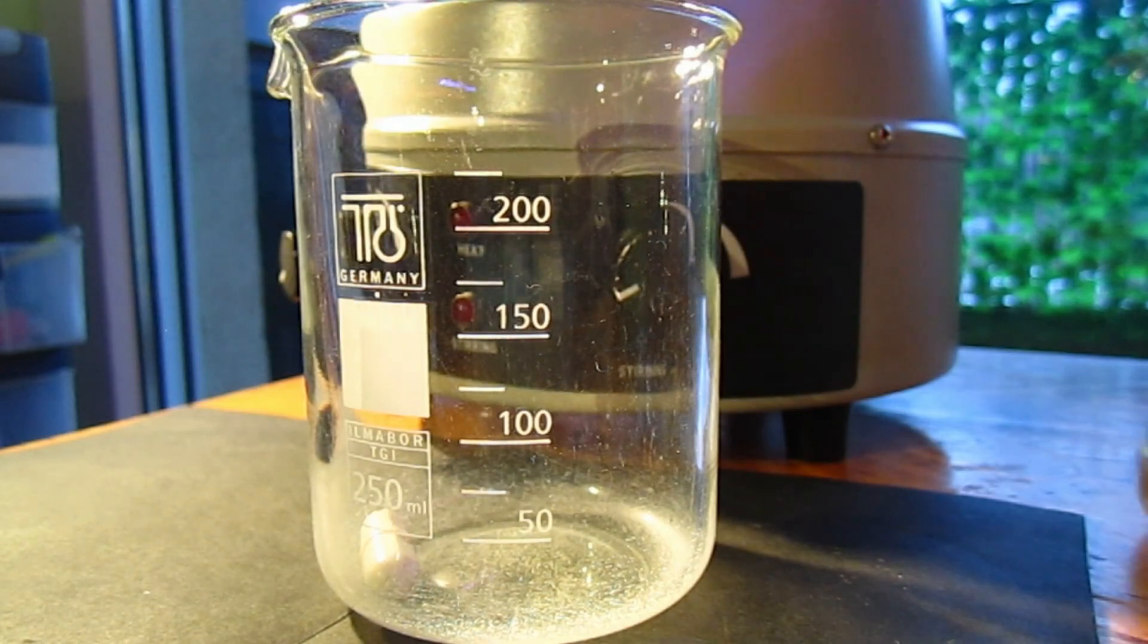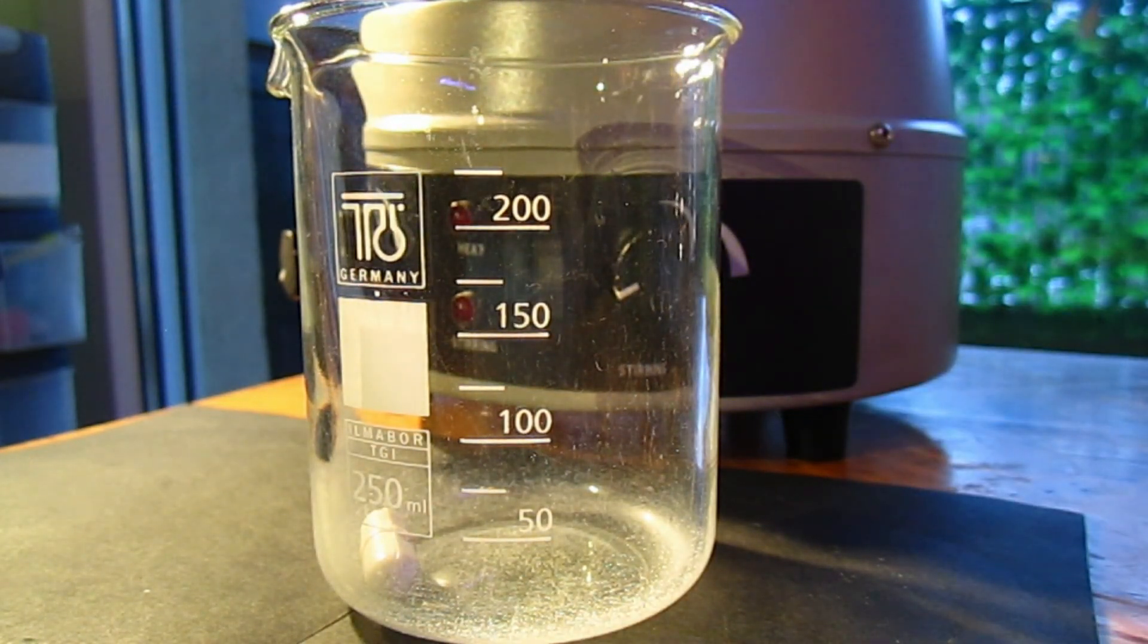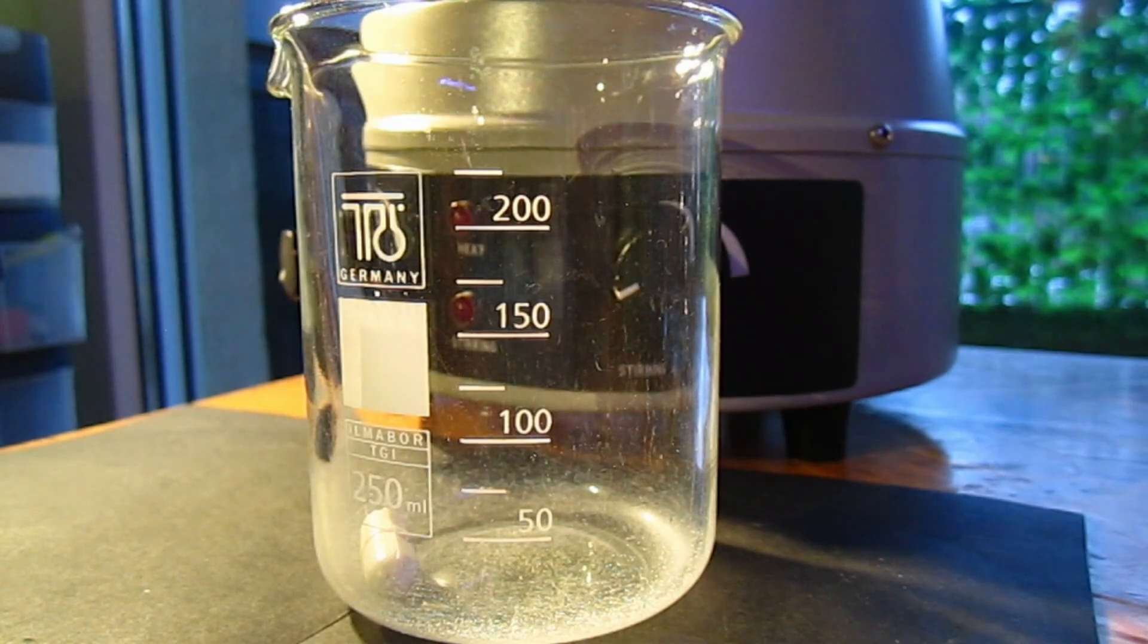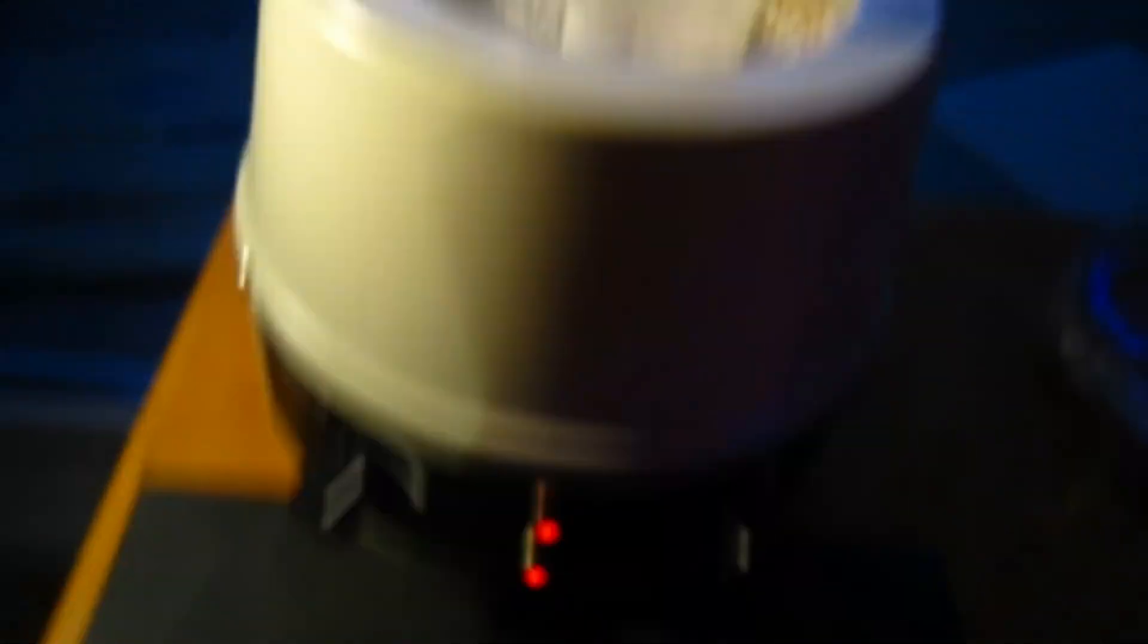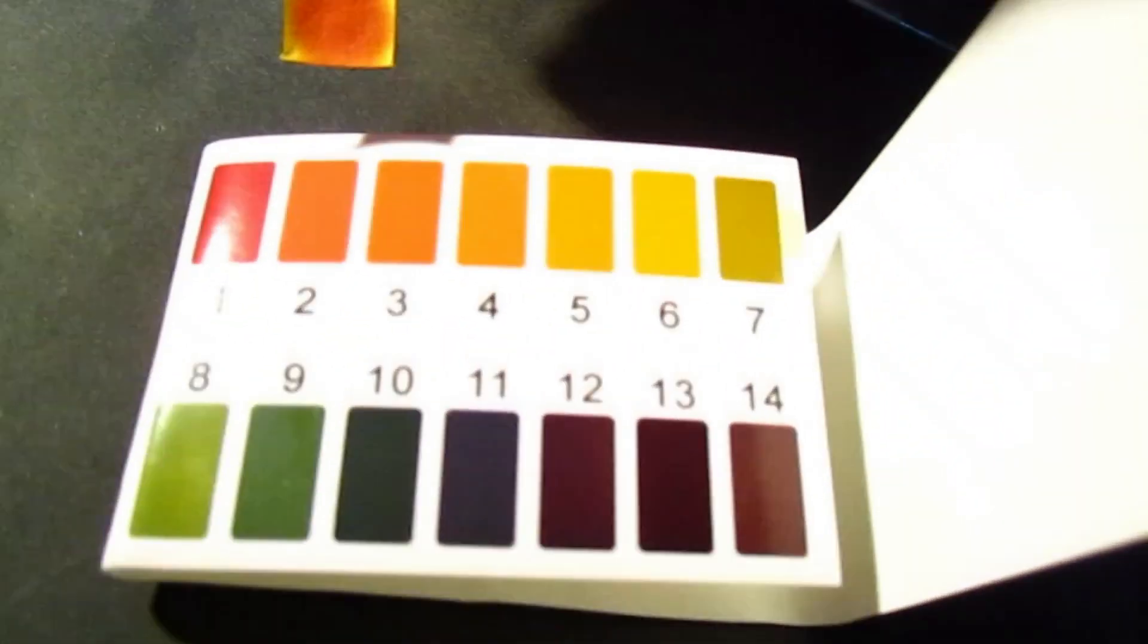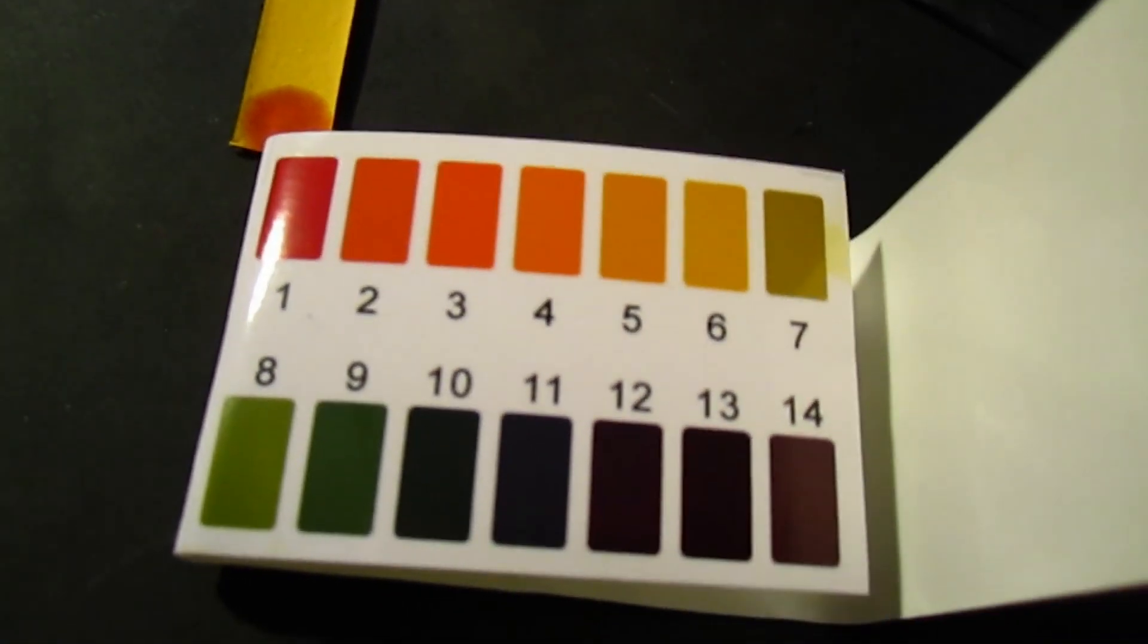I got some water here. I didn't find any solubility table of gallic acid on the internet, so I will have to just see how acidic the solution is.